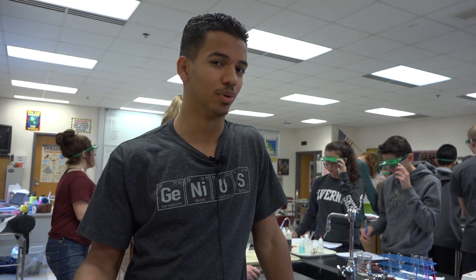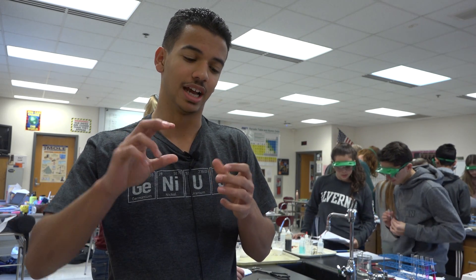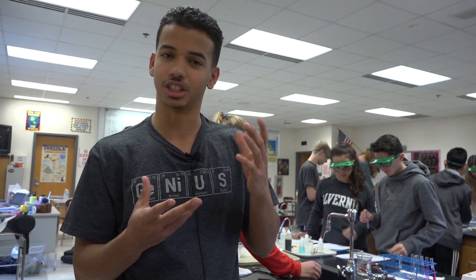Today in chemistry class our teacher gave us three white powders — unidentified chemicals — and told us to run a series of chemical tests to determine what they are. We have to add vinegar, put it in a test tube with water, and add vinegar. It changes color — tincture iodine changes to purple for cornstarch, so it's pretty cool.